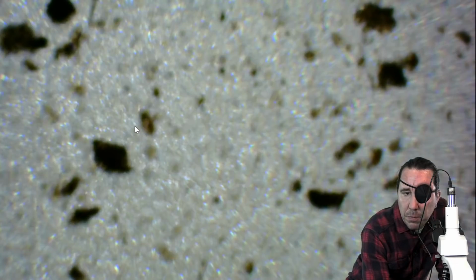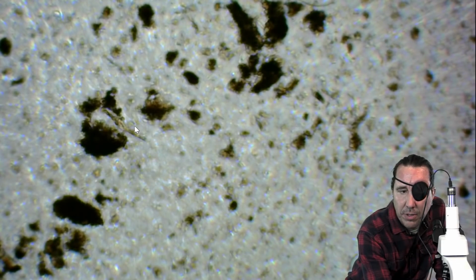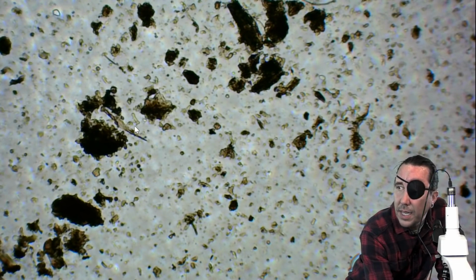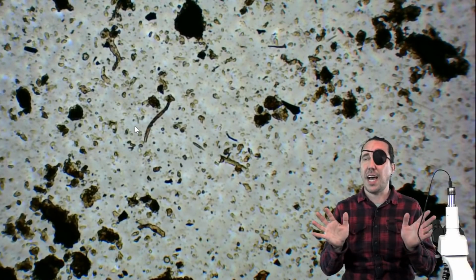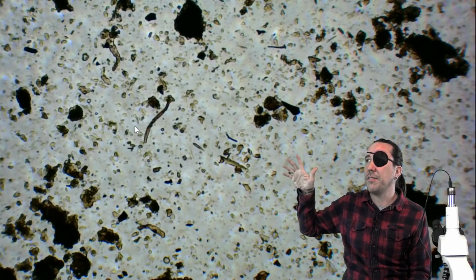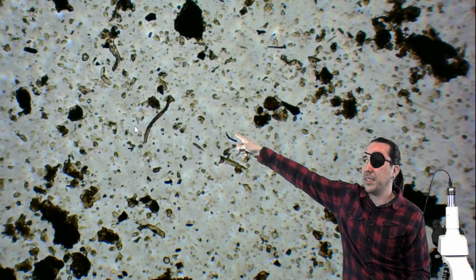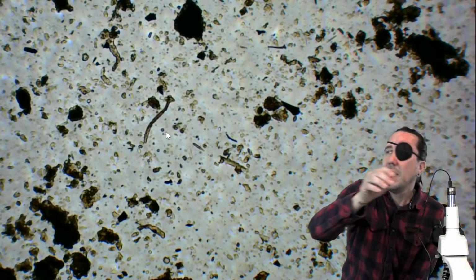So I'm searching through these samples to try and find you all stuff to see because we're on video, but generally I would pick a point like this and just stop. Look for fungal hyphae all the way around here. I don't see any fungal hyphae. This thing is not a fungal hyphae. I can tell right here.